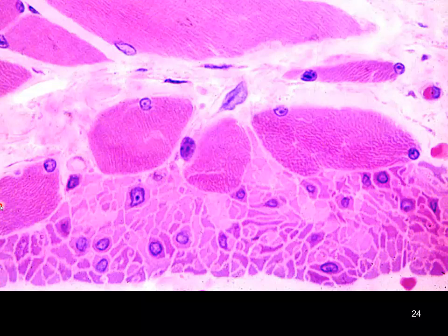And in this micrograph, we can see that we have a cross-section through peripheral muscle. We got peripheral nuclei, so this is skeletal muscle. Here we have another skeletal muscle fiber, that's what all this is. But then all of a sudden we see these rounded cells, large central nucleus. So this is going to be our smooth muscle cut in cross section. So here you can sort of pick up the difference between a smooth muscle cell and a skeletal muscle cell.